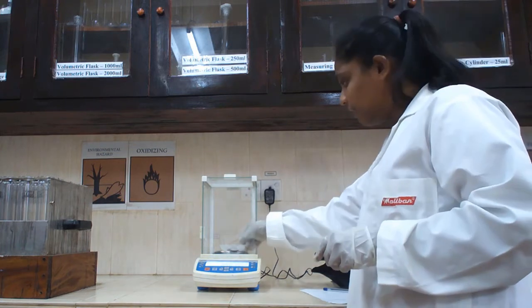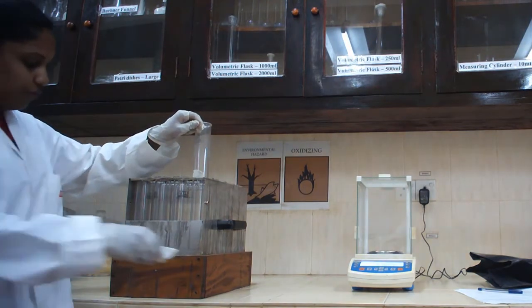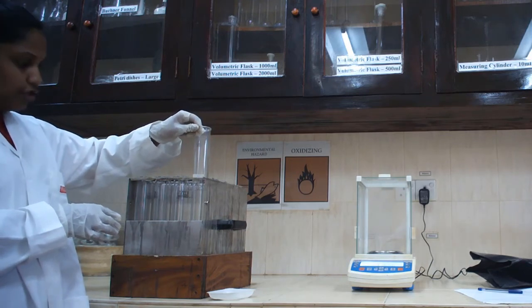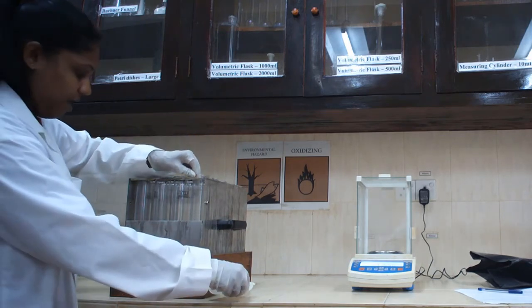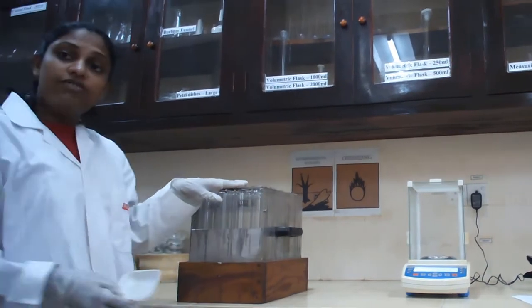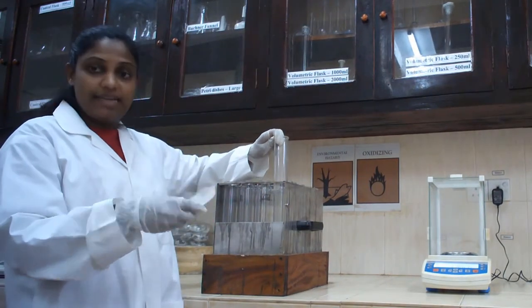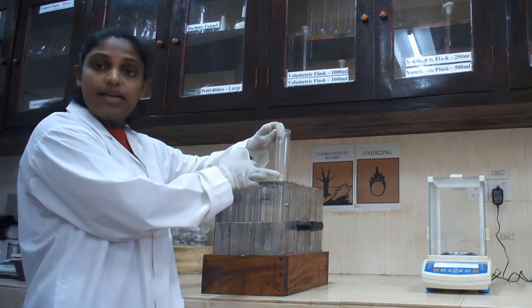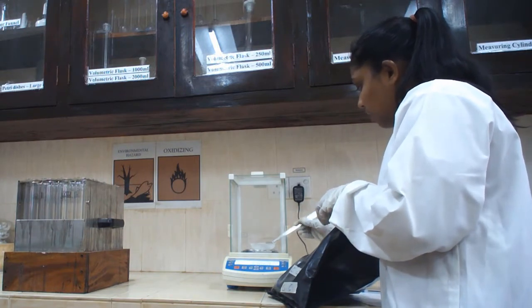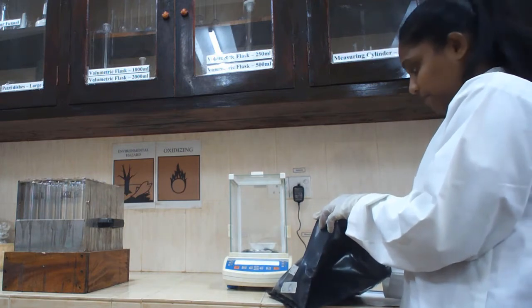Then you have to take it out and put it into this Kjeldahl tube. Before doing that, you have to make sure that you are naming the Kjeldahl tubes based on your sample type and put it into Kjeldahl tubes. When you are transferring this sample into the Kjeldahl tube, be careful not to touch the walls of the Kjeldahl tube. Okay? Your initial sample weight can be changed from your sample type.